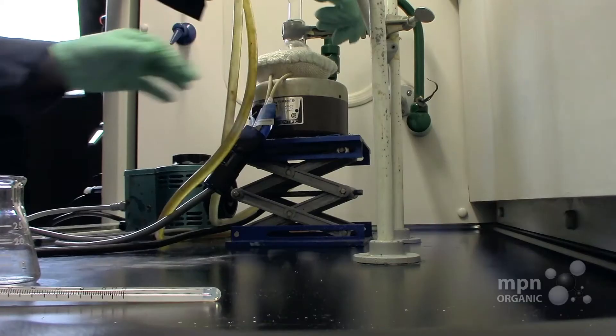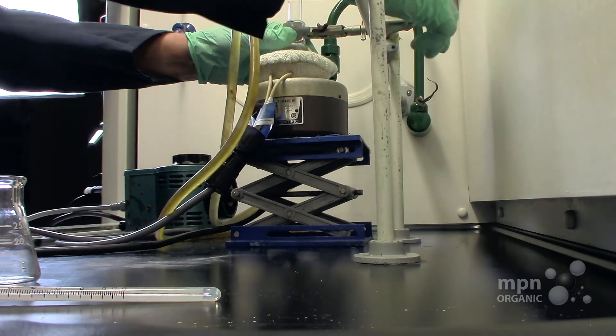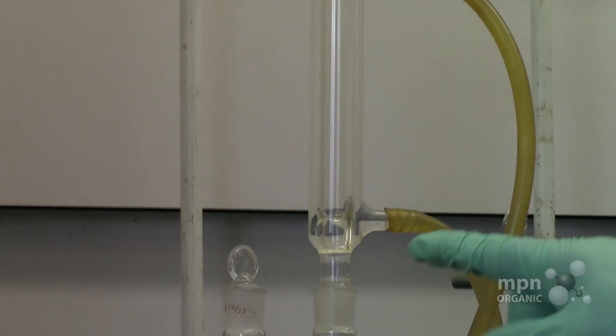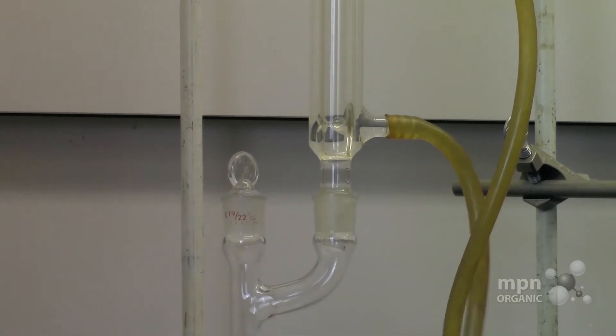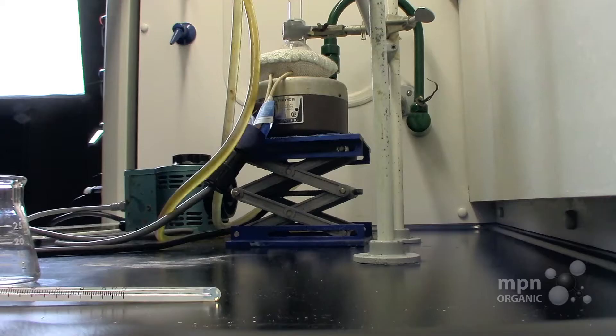Now make sure that when you set this up that you always have this clamp down well. If you don't do that, this can tip over, but this looks like it's pretty well settled here.